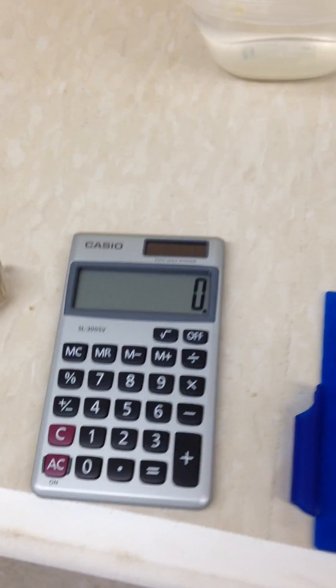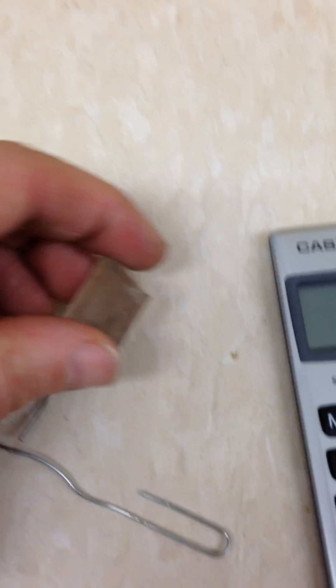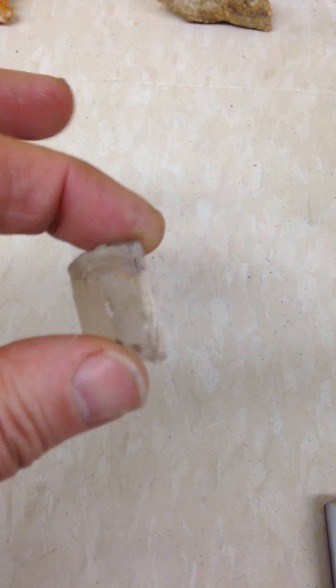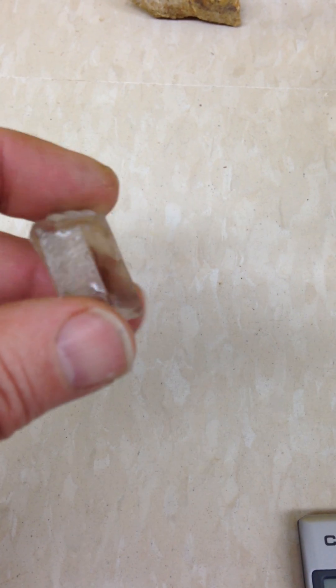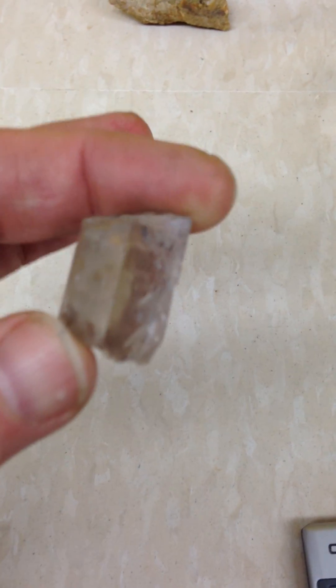In order to do this specific gravity test, you're going to need a few simple things. You're going to need a pad with a pen, a calculator, a paper clip, and a mineral. In this case, this is a mineral that looks to me like it could be smoky quartz — smoky to clear quartz.